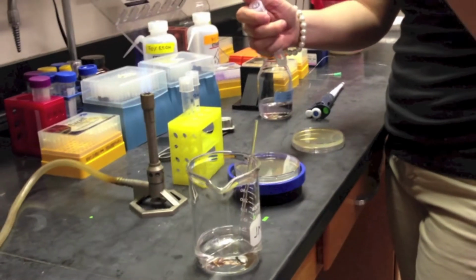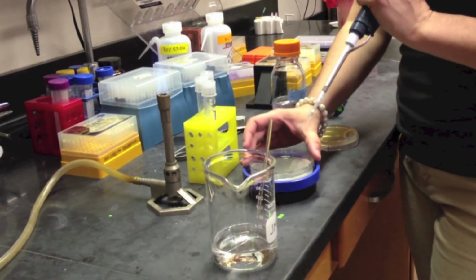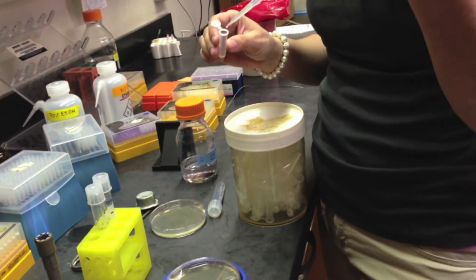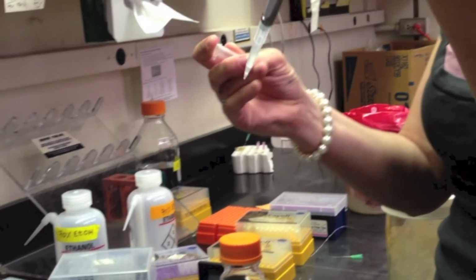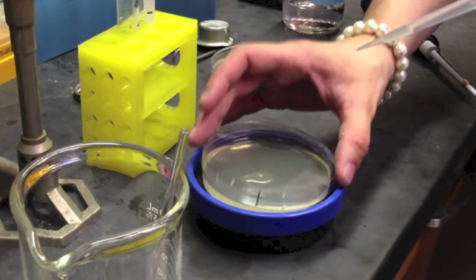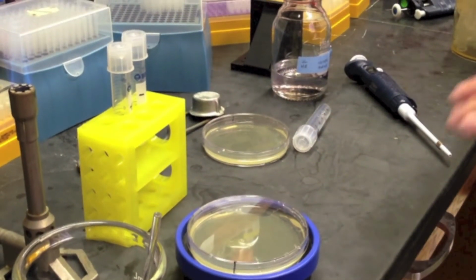The selectable marker is like a survival gene. The most common marker is the AMP-R gene. This gene is resistant against ampicillin, which is the most common antibiotic used in agar plates. Plate the cells carefully. Make sure to have a control plate of the transformed cells without the foreign DNA, labeled No DNA Control, as a basis of comparison.